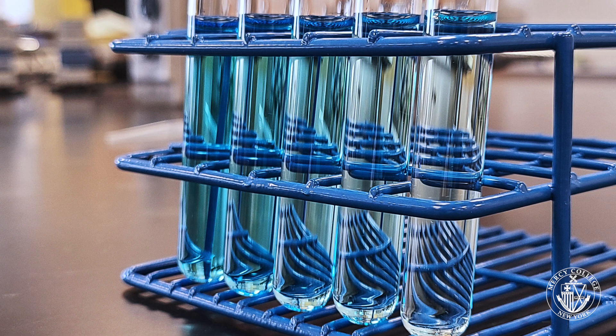The darkest blue will be your most concentrated standard, and the lightest one will be the most dilute.